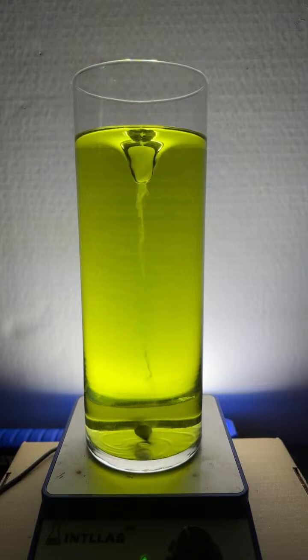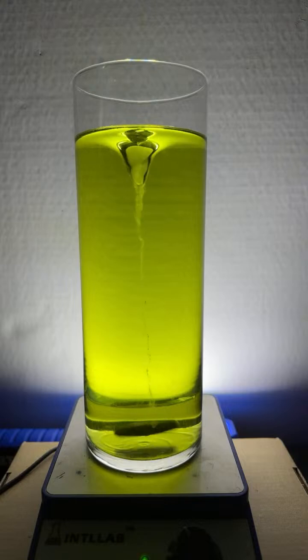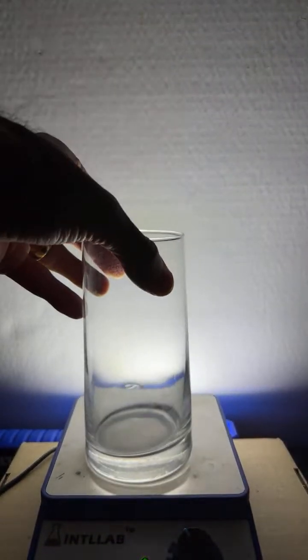All right, let's try this. Let's see if we can try this with the... Where's another flask here? I got a flask here I can do this with. A bigger one. Uh-oh. Where's the other flask? Well, we'll just try it with a little one. We'll do it with this. Okay. Try this flask here. It's a little one.